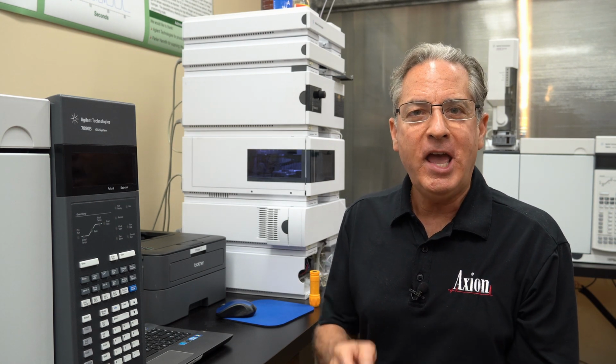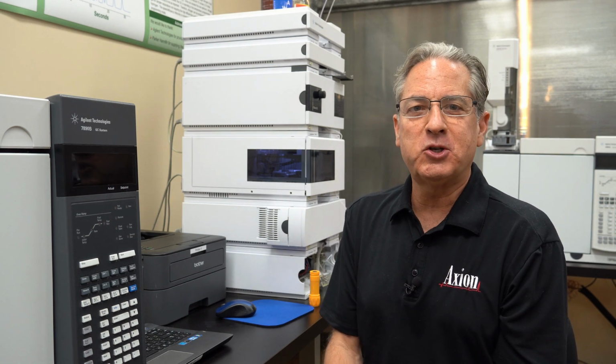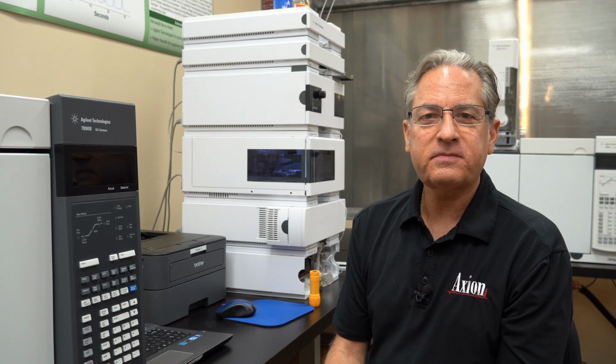So lots of cool things out there. This is stuff that most of us have access to, but most of us have never been taught how to use it, and now you know how to use it. So that's some extra tips when it comes to HPLC troubleshooting and diagnostics.